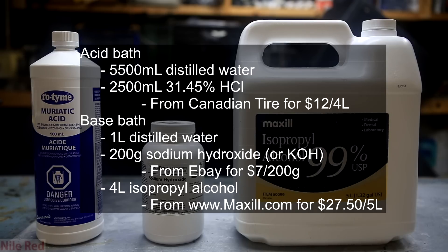By request I've included the sources and the costs of the chemicals that I use. Both are very easy to make, but the base bath is considerably more costly due to the use of isopropyl alcohol and sodium hydroxide instead of just straight-up cheap hydrochloric acid.